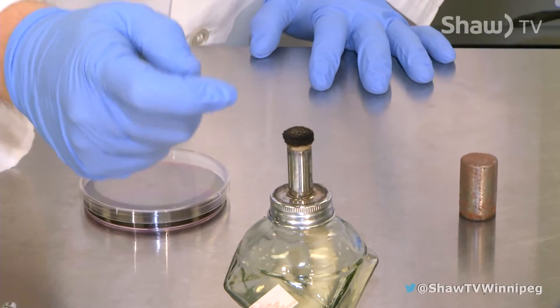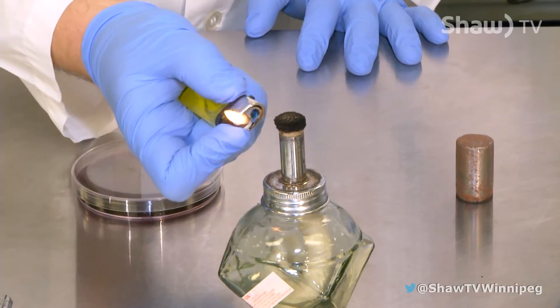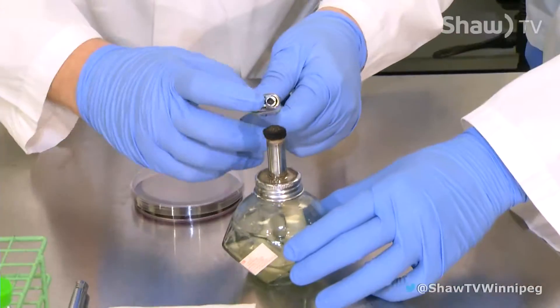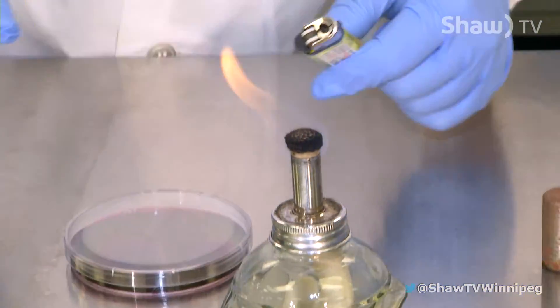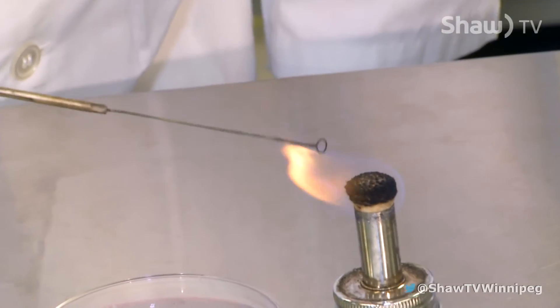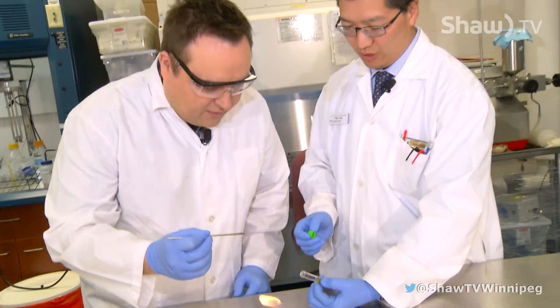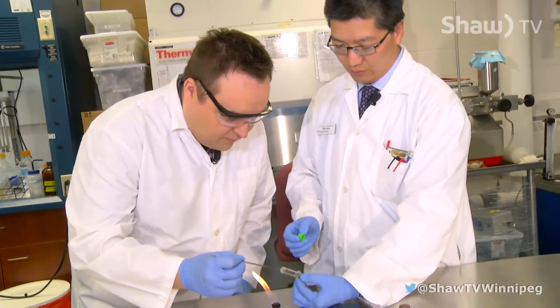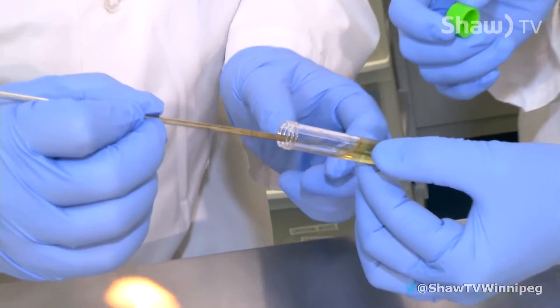Most people think bacteria are bad, but the bacteria we're using are good — we're exploiting them instead of them exploiting us. Now with the inoculation loop, I always feel like I burn my finger with these lighters. Look at that — I'm going to melt my glove. Okay, that lit very quickly — looks like I'm roasting a tiny marshmallow.